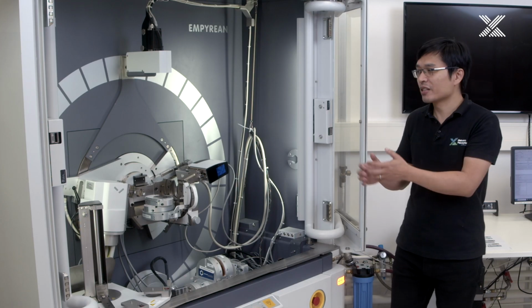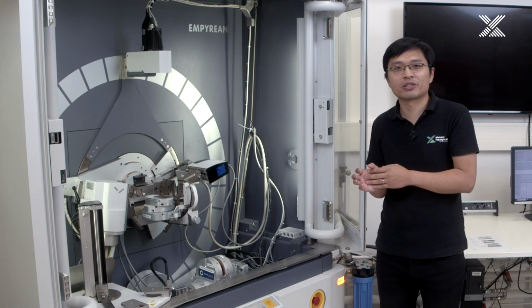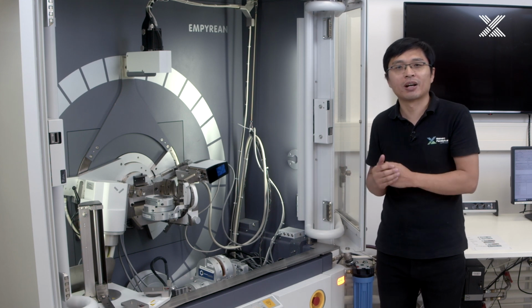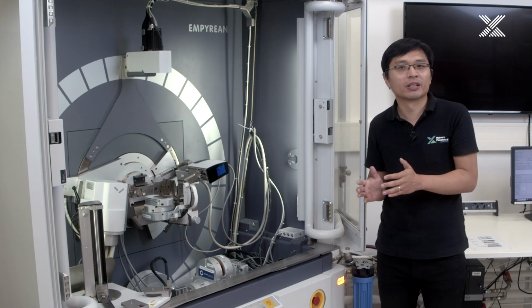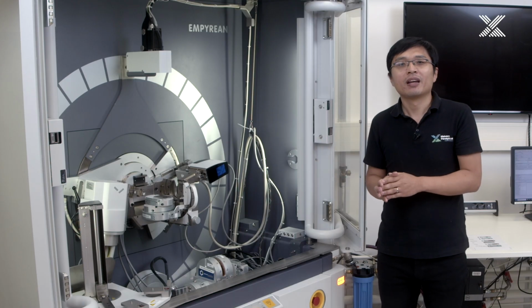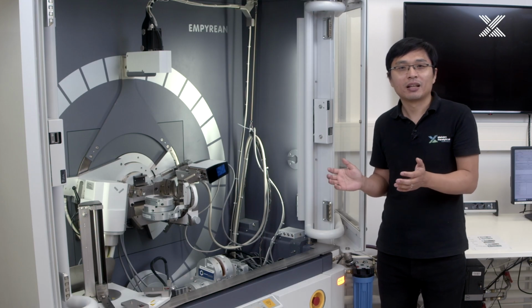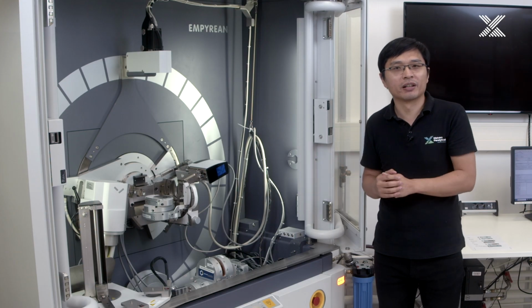Another advantage of doing XAS on this diffractometer, on this Empyrean system, is that we can do a complete goniometer scan to do the measurement from very low angle to very high angle without limit. That makes this XAS solution unique for any applications. For example, you can do a multiple edge measurement for a compound like barium titanate. You can do the K edge and L edge measurements in one go from low angle to high angle.